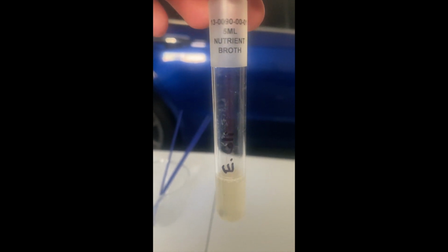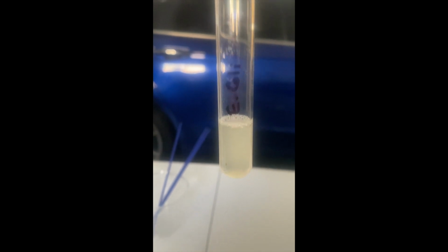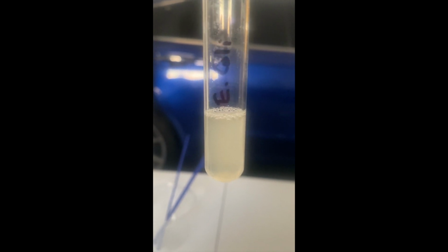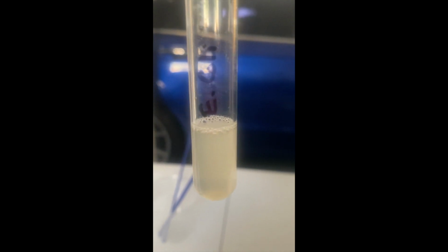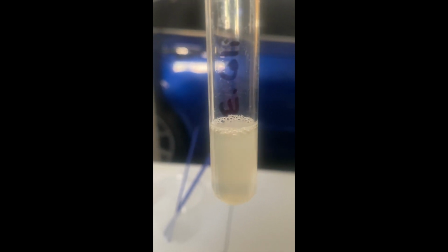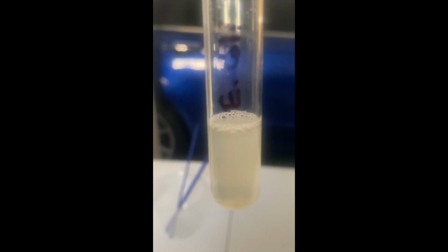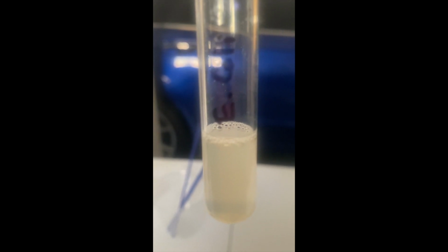Let me just flip the camera angle. I think that would help. So this is my specimen here for E. coli that I've developed in nutrient broth. As you can see, it is a bit turbid and a bit flocculent, and there is some growth at the bottom. So I'm pretty sure there is some E. coli in there. Now, E. coli, of course, is normal flora that lives in our intestines. But it can also be pathogenic. It can also cause digestive diseases, diarrhea, and other nasty things among them.